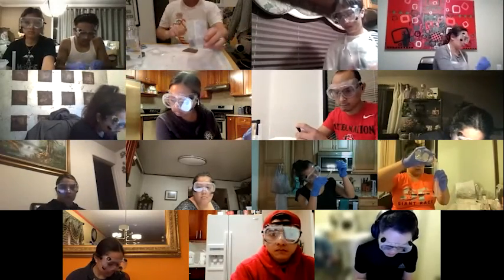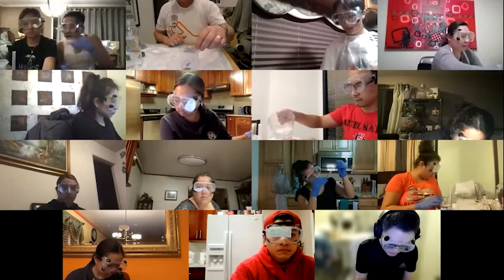Then the reaction starts to pick up, starts to go a little bit faster. Right now, I've got about half the tube empty. Not empty, of course. There should be hydrogen gas in there. If it was empty, it wouldn't be pushing the water out.